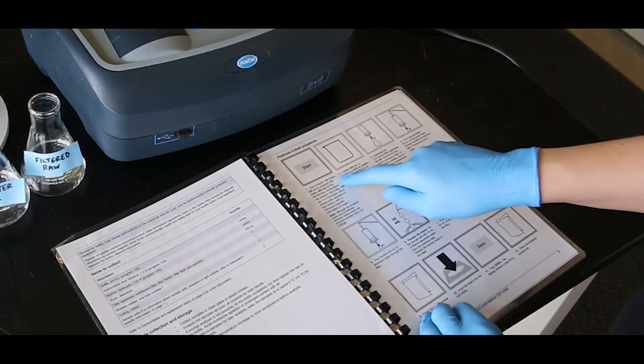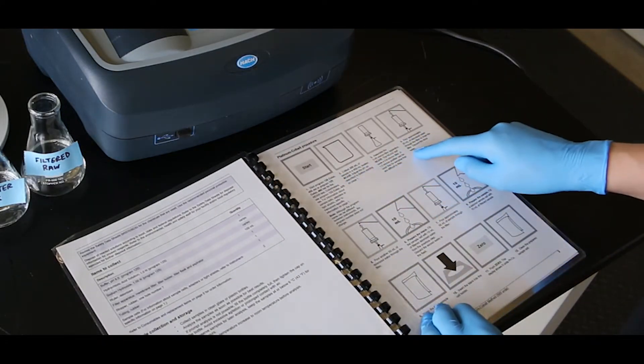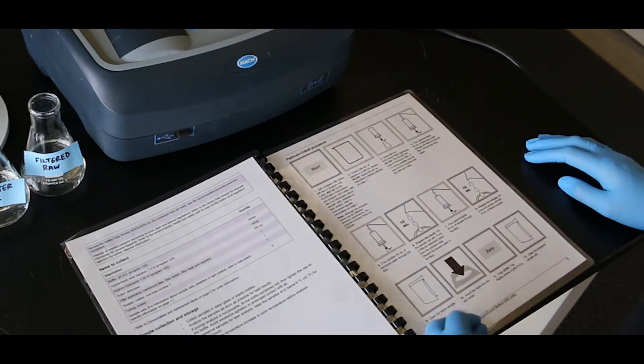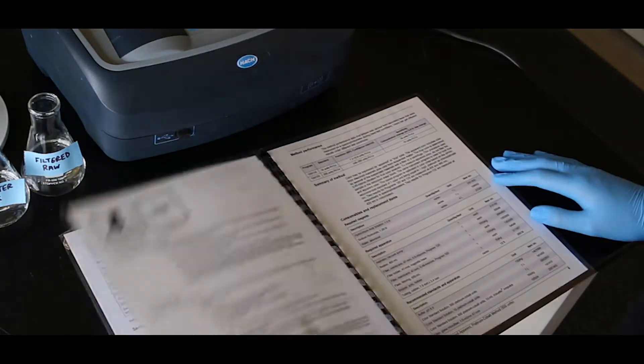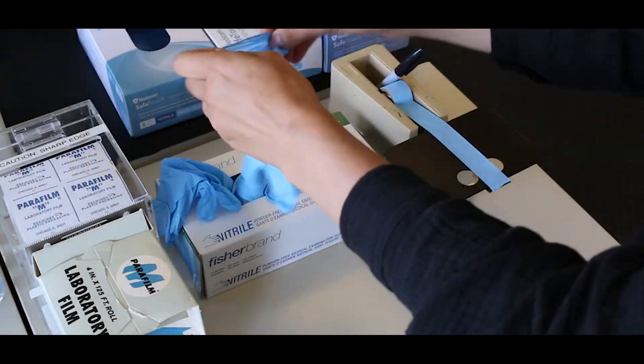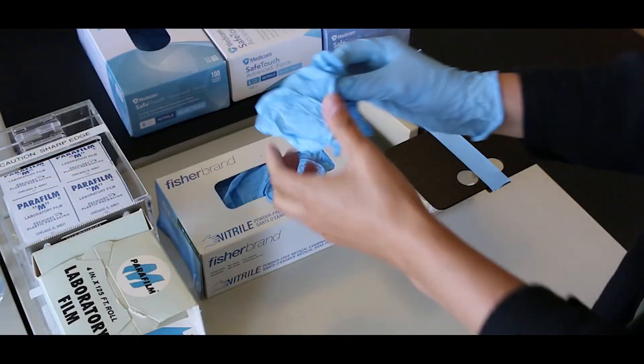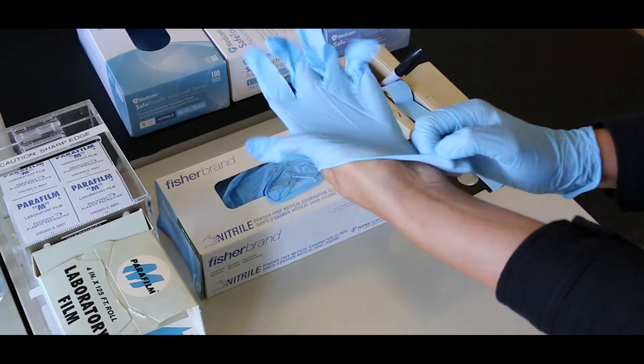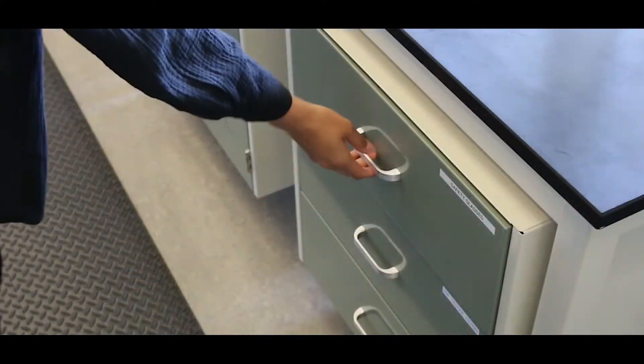This is a basic overview. You should always refer to the methods and procedures specifically provided for your equipment. It is also important to review the safety data sheets for the reagents used and to use any personal protective equipment that is recommended.